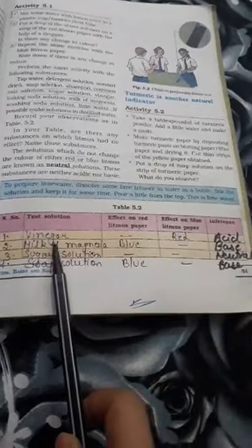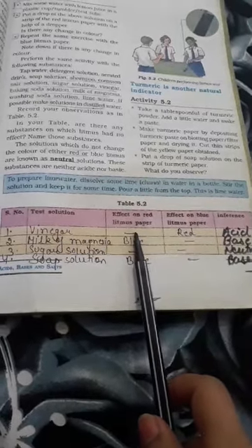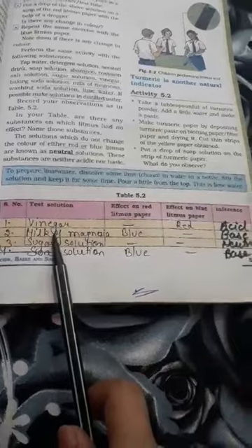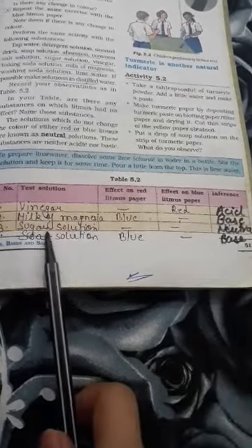First, I have vinegar. When we test this with red litmus paper we will see no color change, but it is going to turn blue litmus to red — that means it is acidic in nature. Then we have a solution of milk of magnesia. It will turn red litmus to blue, and with blue litmus paper it will show no color change — that means it is basic in nature.